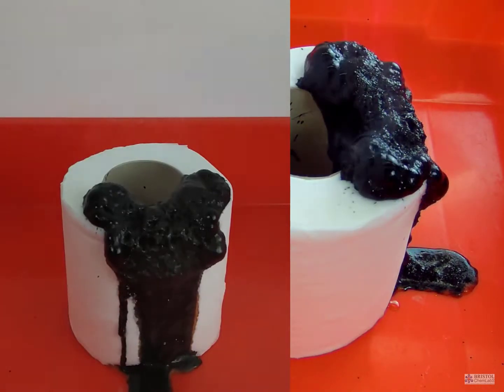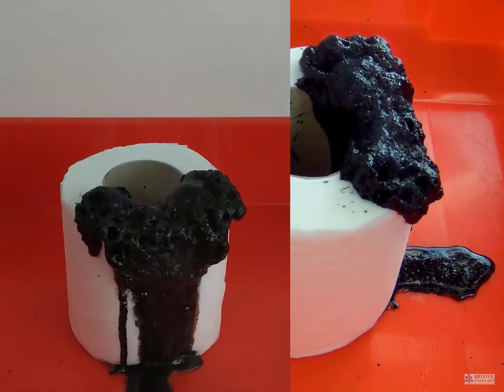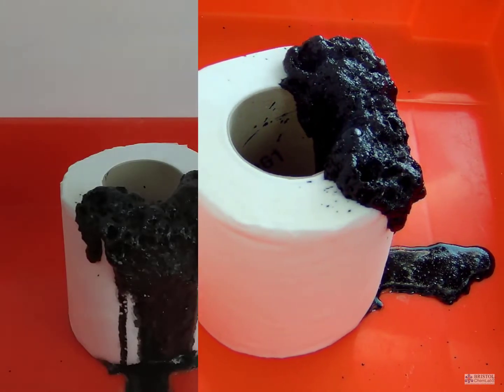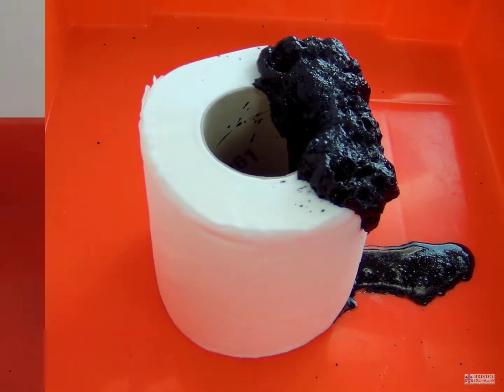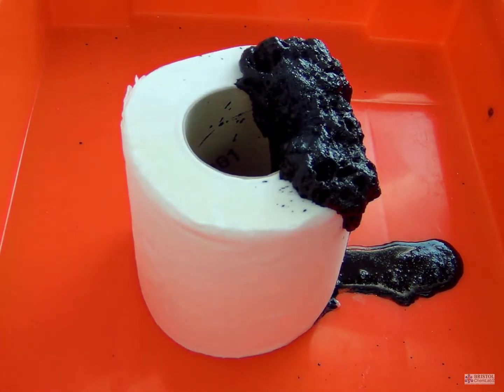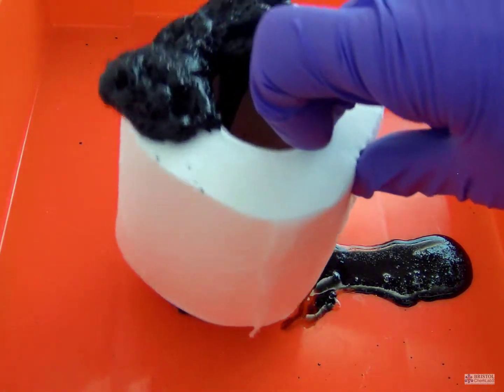This is an exothermic reaction. The setup is straightforward: place a toilet roll onto a tray, pour a small volume of concentrated sulfuric acid on the toilet roll, and stand back.